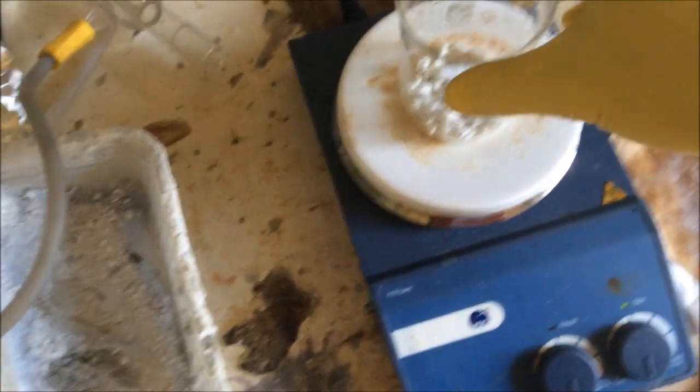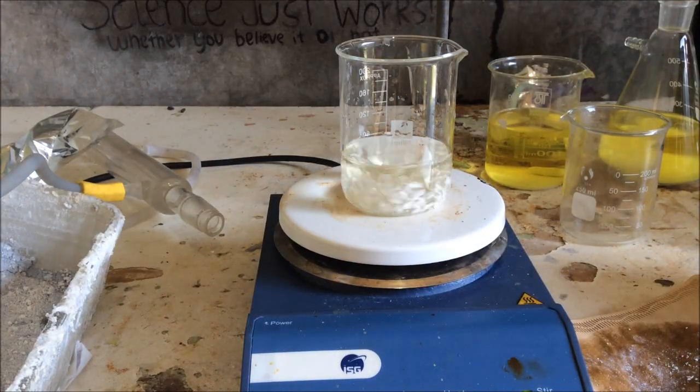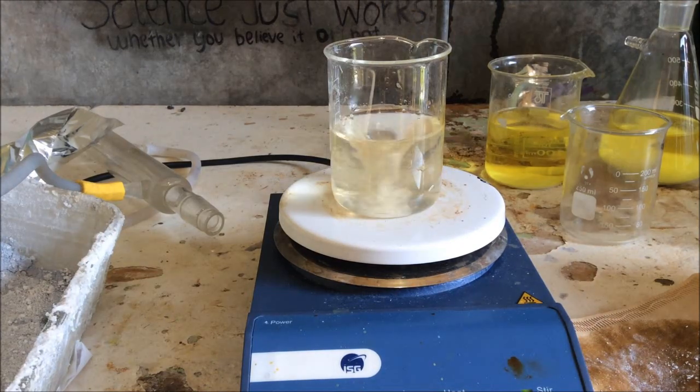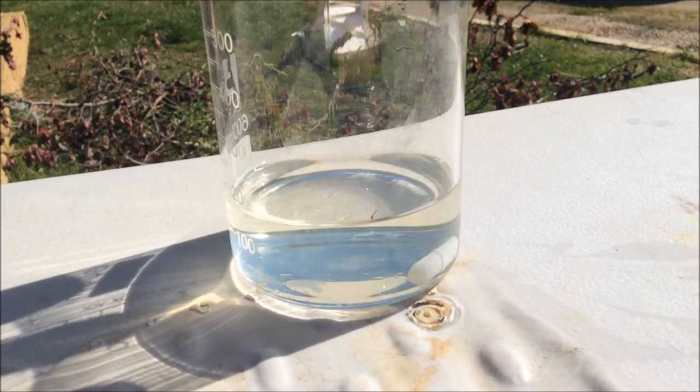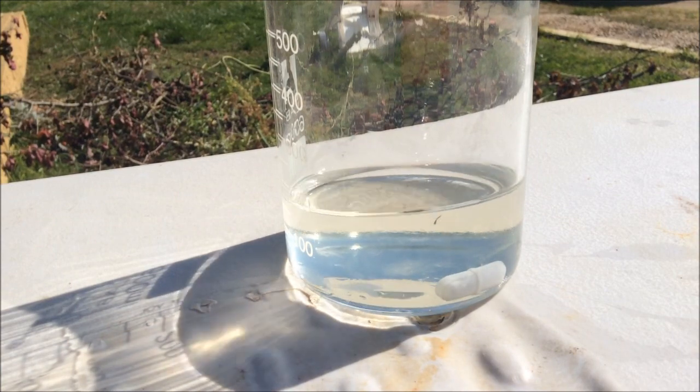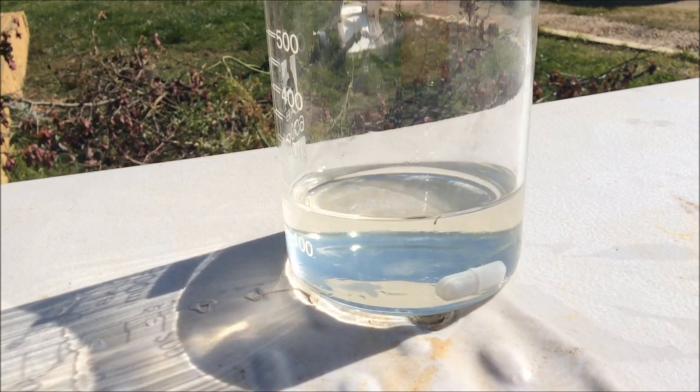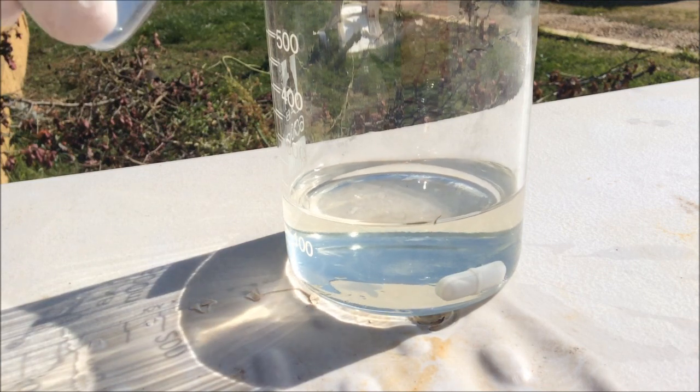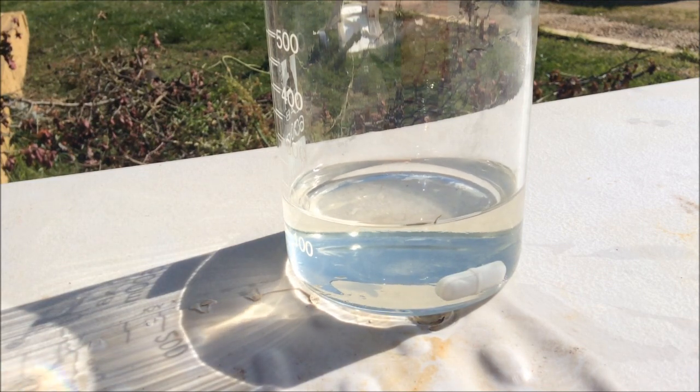And we're going to dissolve this in a bit of water. I did a quick gravity filter just because there was some floaties still left in there that wouldn't quite dissolve. So we have sodium terephthalate in our solution. So now all that is left to do is to add a mineral acid of your choosing, in which case my choosing is hydrochloric.